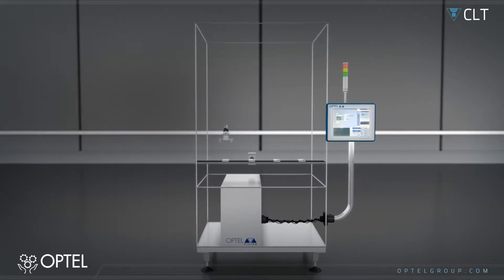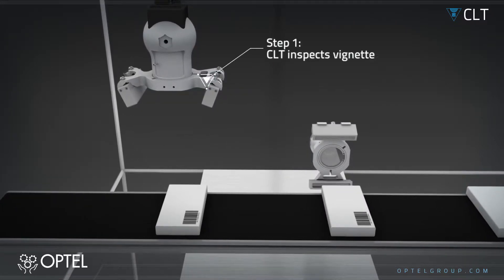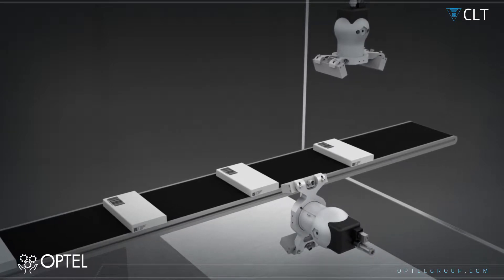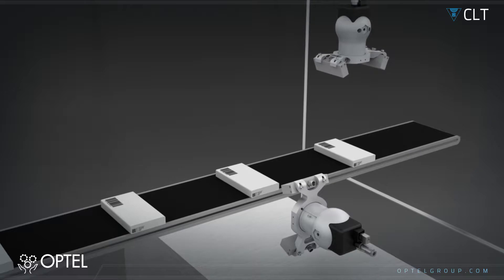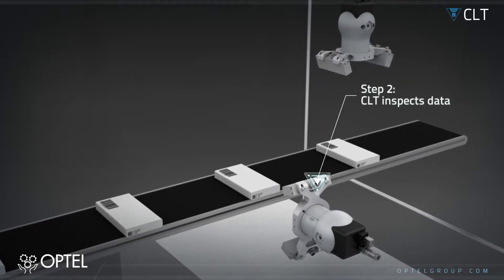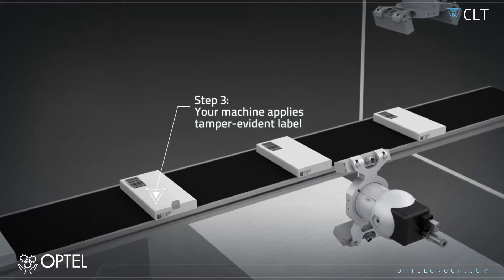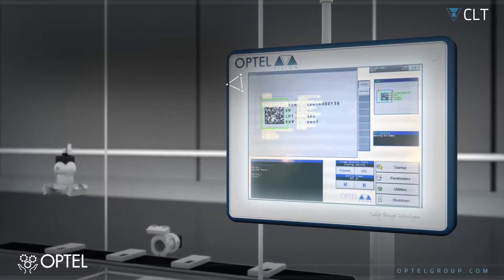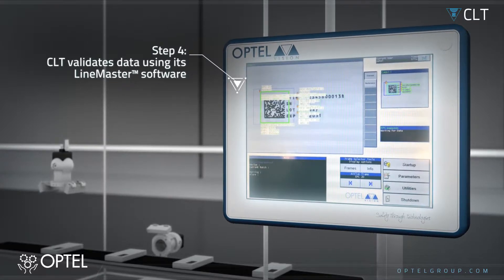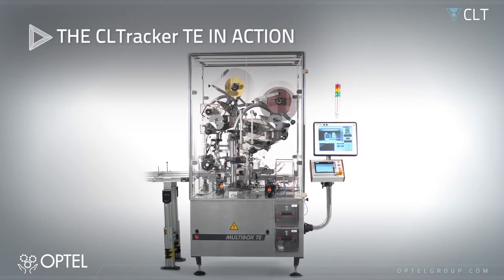If you apply tamper evident labels or vignettes to your cartons, the CLT can check their presence, inspect them, and even serialize, validate, and transmit the data. The label is applied to the carton, the serialized data is printed, inspected, and compared with data from the database.